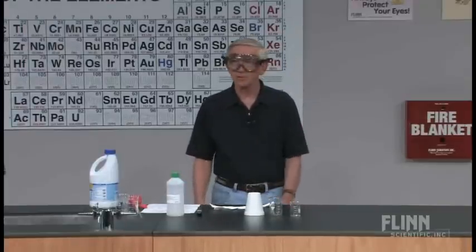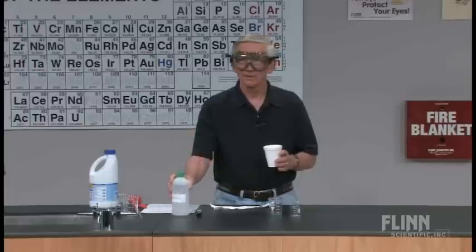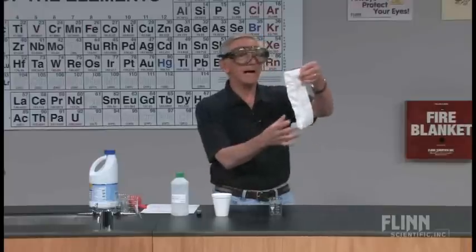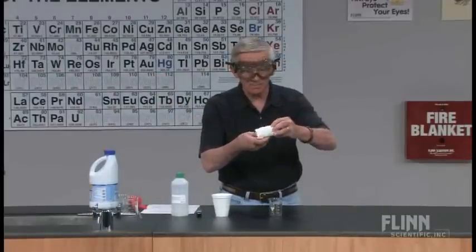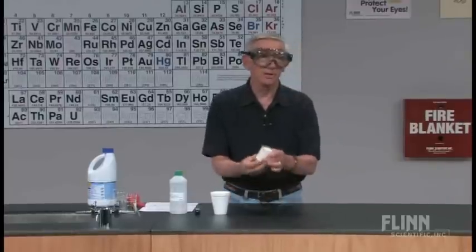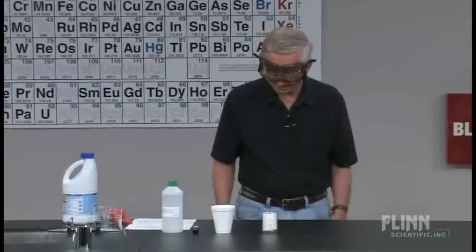I wanted to do it small scale, and most of our chemistry lab calorimeters are coffee cup calorimeters. We all know what happens if you put acetone in a coffee cup — not going to work. But it turns out that if you take a paper towel — you may not have this kind of paper towels, maybe you have the rolls or whatever, you need to experiment a little bit — if you take one towel around a 50 milliliter beaker and nest it in a 100 milliliter beaker, you'll get a nicely insulated calorimeter. To minimize exchange with the air, you need a lid.